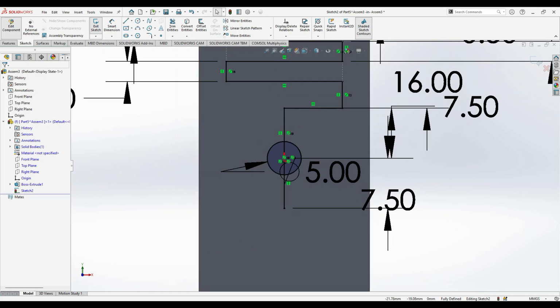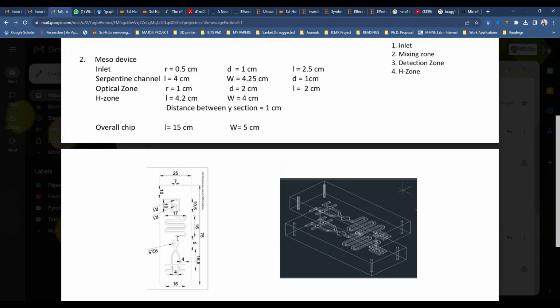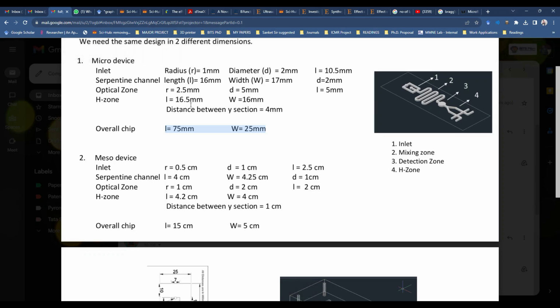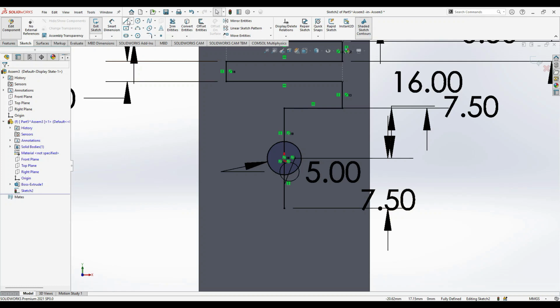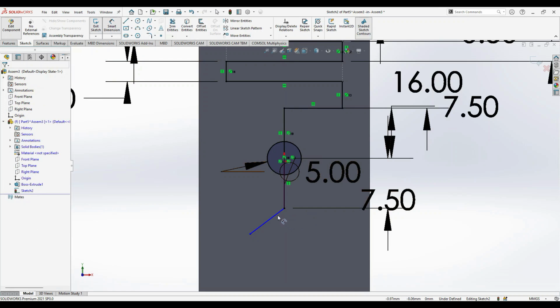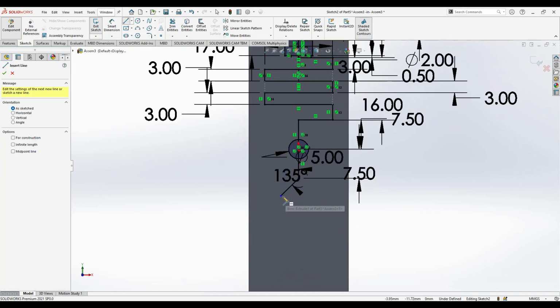Okay, and then we'll go back to design, and then we have a Y-shaped channel. The Y optical zone channel we have 2.5, diameter 5, and length as 5, and then the H zone we have to create 16.5 length and width as 16 mm. Okay, first of all we just create a Y, and the angle will be 135 degrees. Okay, so randomly I'm just creating a Y.